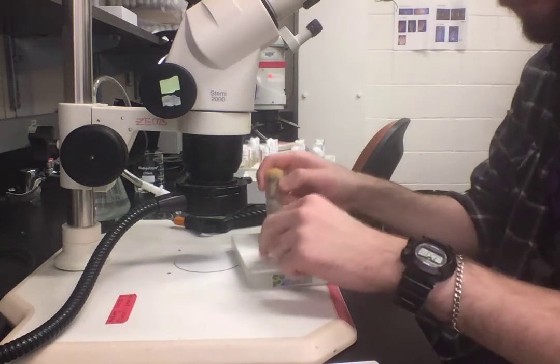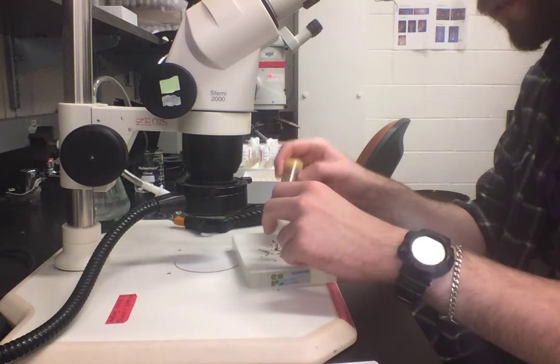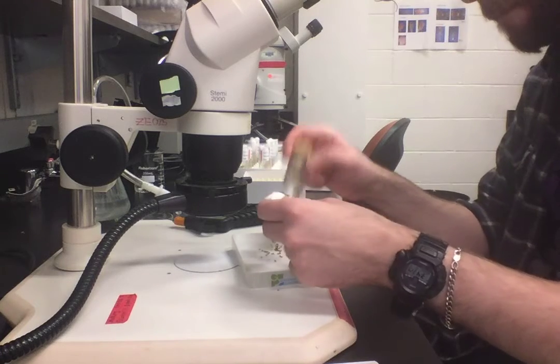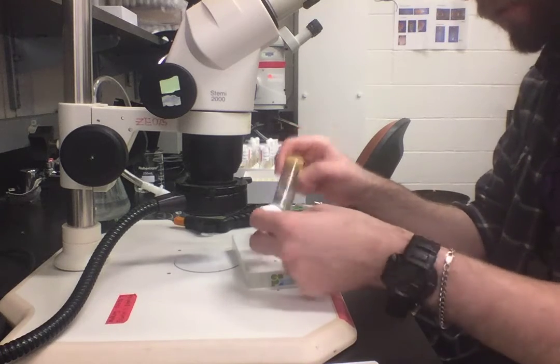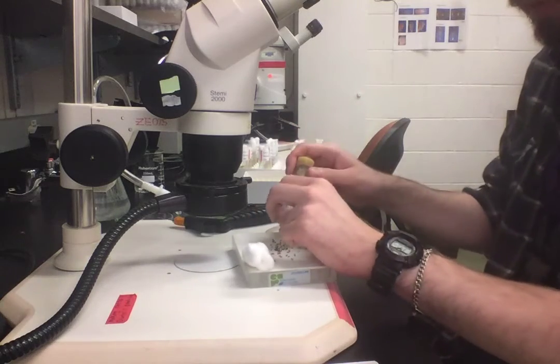Tap out as many flies as you can, and then if you're going to do anything else to them, you're going to knock them all onto the flow pad. Again, my cotton ball's really sticky, so they're all a little stuck to it.